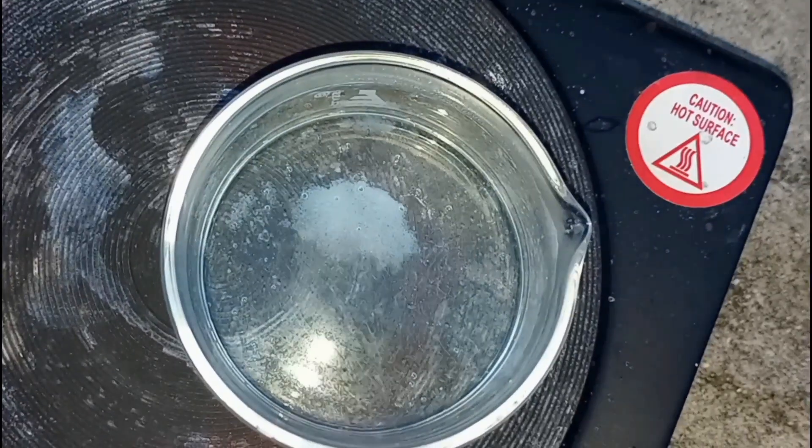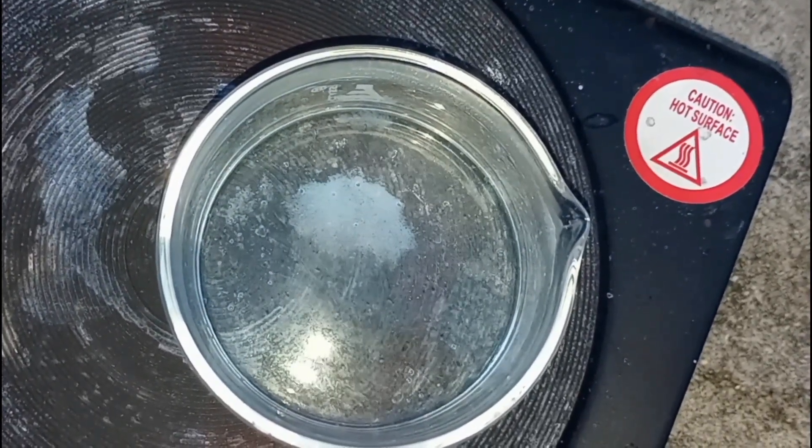I was really careful not to let the temperature get too high. And I believe what we have here is zinc acetate and not zinc oxide. So, it's getting reduced, and I wanted to get it out of the evaporating dish and into a petri dish soon. And this happened overnight.